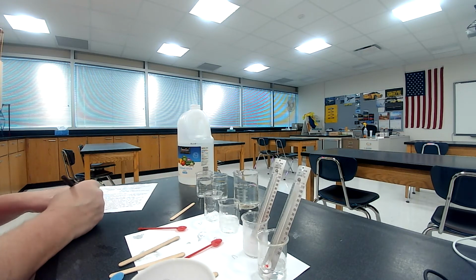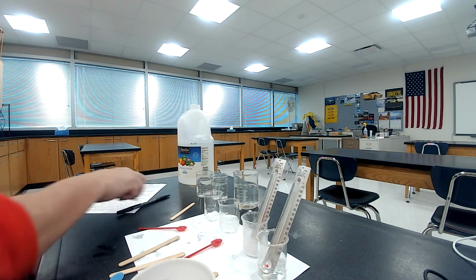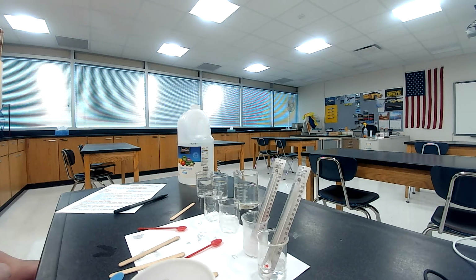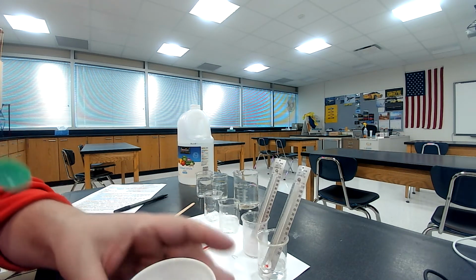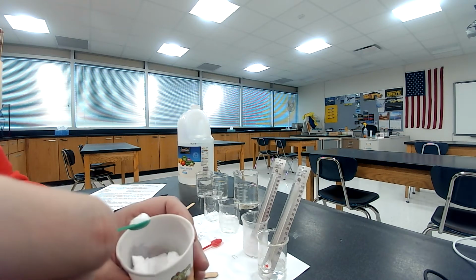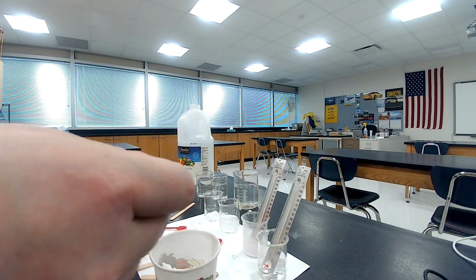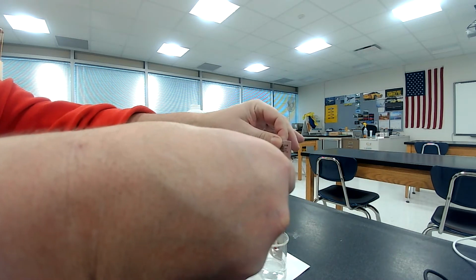All right. Okay, and next it says, using a small plastic spoon, scoop 1 spoonful of baking soda and level it with a wooden stick. Now, I think if you were anything like me when I was a kid, if I had baking soda and vinegar at home, I know what it would do. Okay, so I'm going to pour this in here, and I think you're going to know exactly what it's going to do. But first, what I'm going to do is take this out, and then I'll pour it in here.